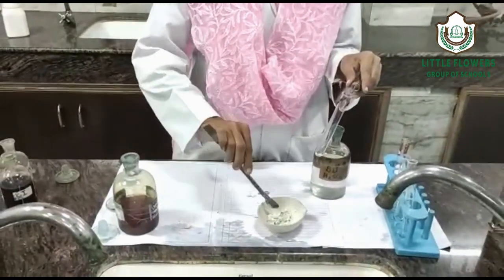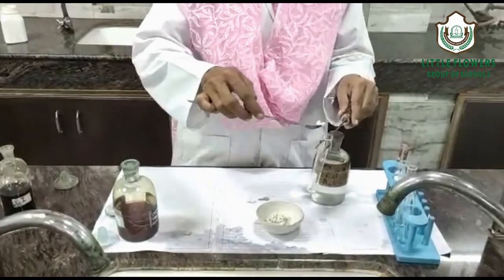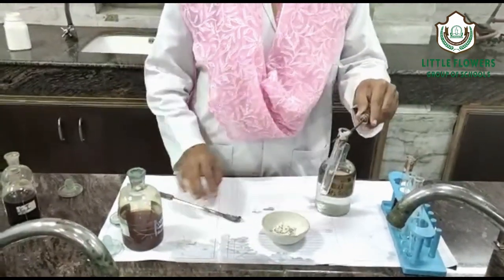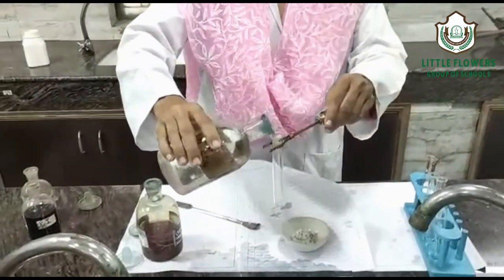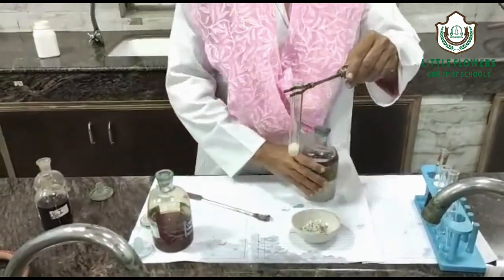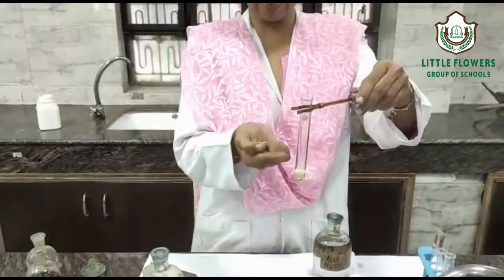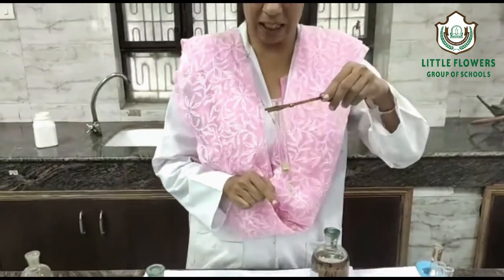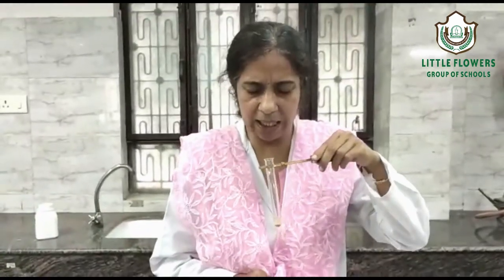We will add dilute H₂SO₄ to the salt. We are adding the dilute H₂SO₄ to the salt. You can see some effervescence — this is H₂S gas with a rotten egg odour.